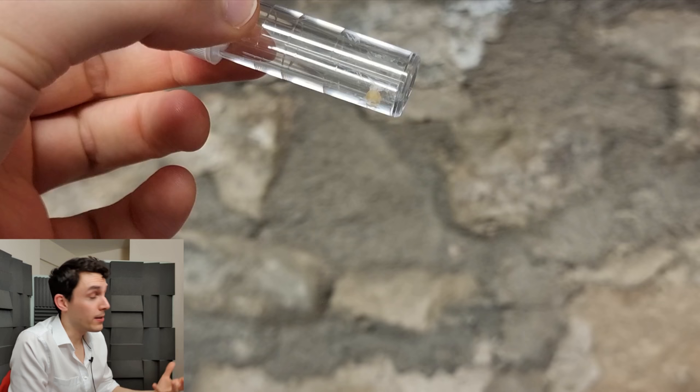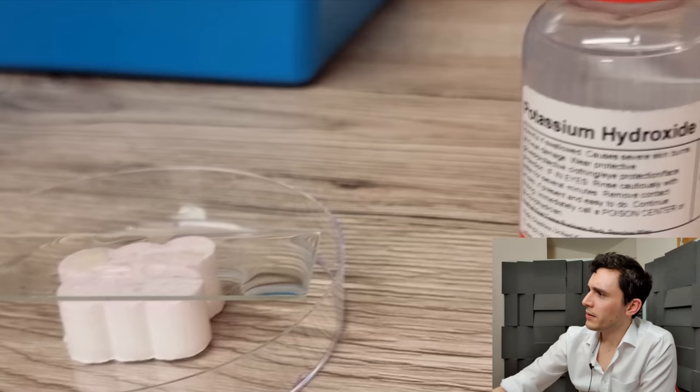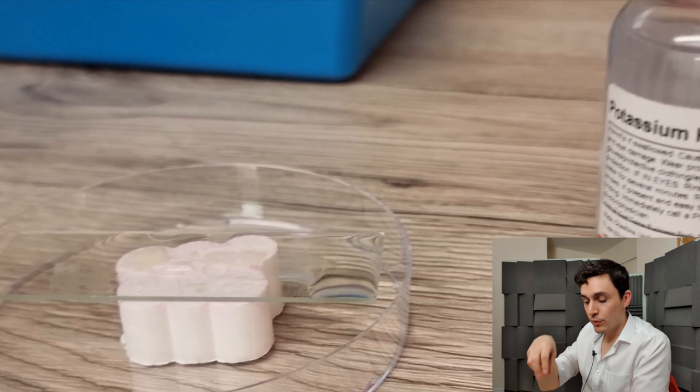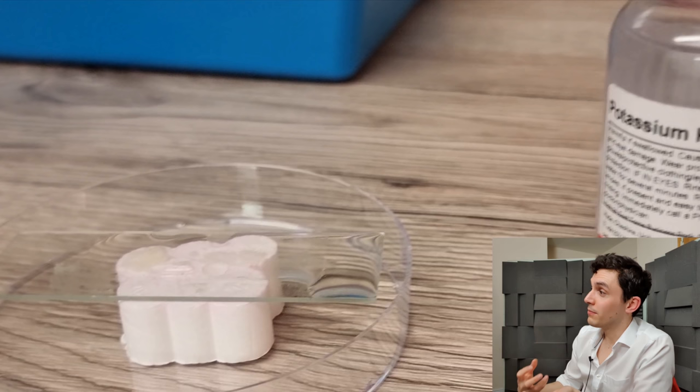So dead skin in the little sample container, and what I've done here — you can see this kind of glass microscope slide balanced there — I've tried my best to put a little blob of that dead skin on the microscope slide and basically smear it like pâté very thinly across the slide. It's not perfect, but I don't have good lab equipment, so I've really just used another microscope slide to smear the dead skin across.